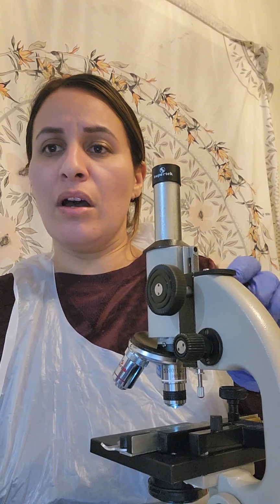So this is experiment 1, just showing basically how to focus and use the microscope in itself. So I'm going to go ahead and clean up. Like I said, I've already uploaded the pictures, and that's it.